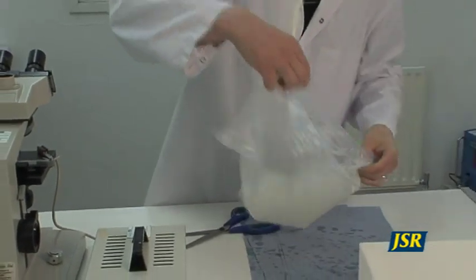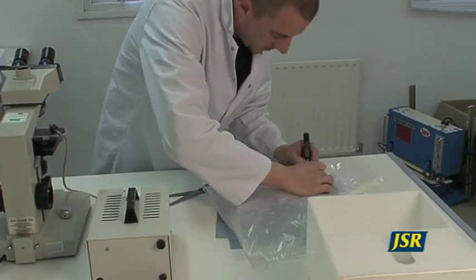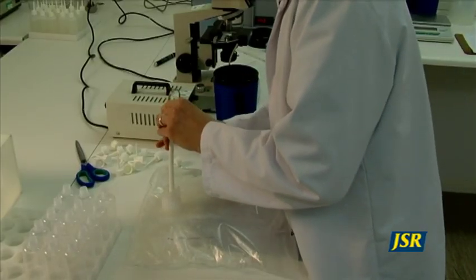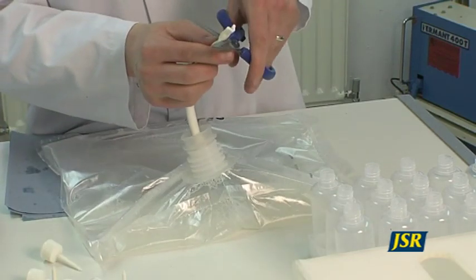If your motility is satisfactory, pour the semen into the diluent — never pour diluent into the semen. Gently massage and mix the semen in the bag and record your date and boar number on the bag. Using the pouring clamp, fill up your dosing bottles as shown, and seal the bottles ready for storage.